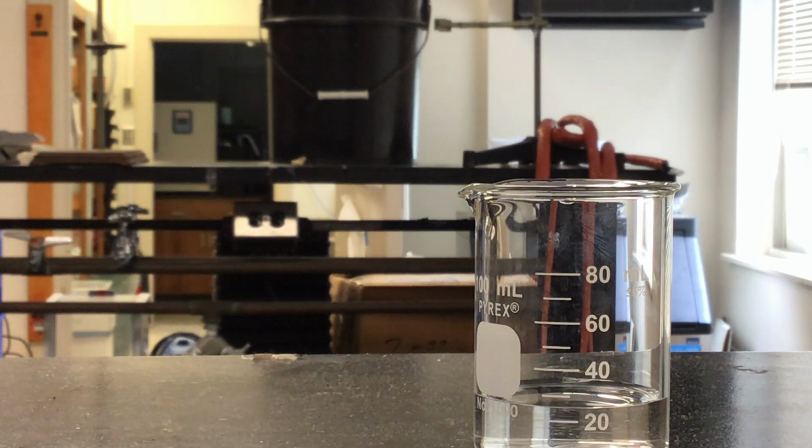And that's really one of the major things this lab wants to highlight: getting in the habit of how many significant digits we should be reporting. It's usually one decimal place further than your normal calibration marks or tick marks on that measuring tool. And getting in the habit of graduated cylinders being better than beakers or flasks. Which means if you're measuring out a volume in this class, and it's a volume that the number matters for, you probably want to use a graduated cylinder. If it's just a generic about 30 milliliters, and it doesn't even say 30.0, it just says about 30 milliliters, you can just use a beaker to measure that out, because that amount probably doesn't matter exactly for what we're doing. So that gives you some introduction to how to pick a measuring tool a little bit as well. Some other things like that you'll see as we get into the experiment itself.